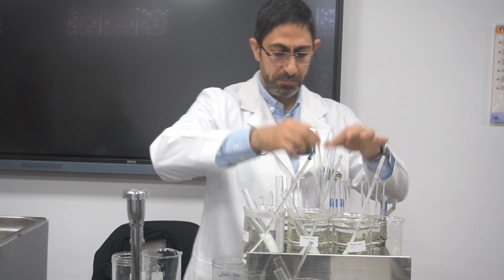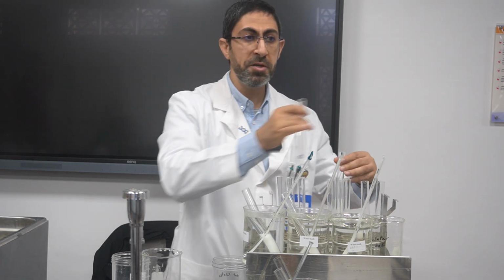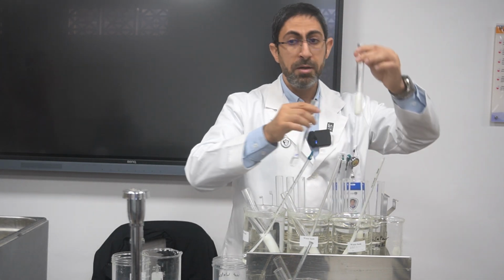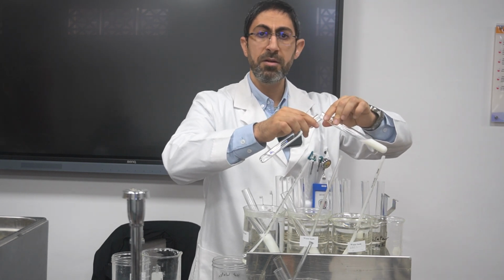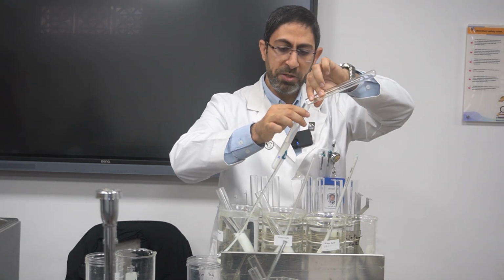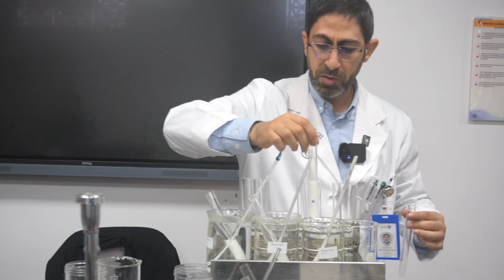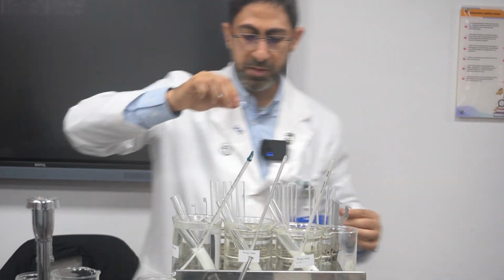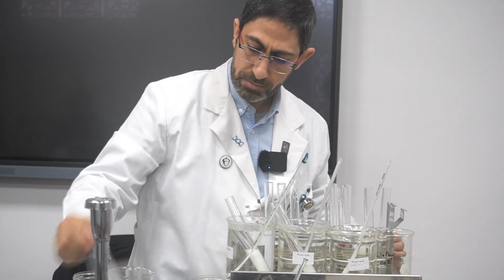Then those that have the stopwatch, for each one, as I told you. Okay, the third one, please. 10 centimeter cubed of the powdered milk with 2 centimeter cubed of the enzyme and 2 centimeter cubed of the buffer in 40 degrees. I will mix them thoroughly.